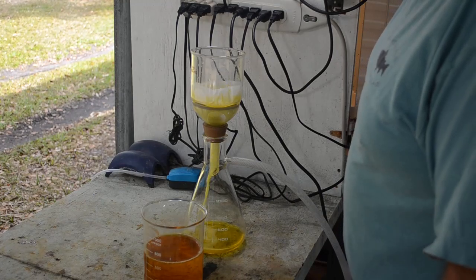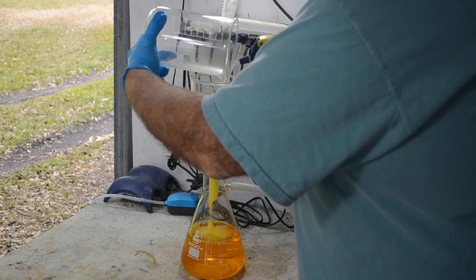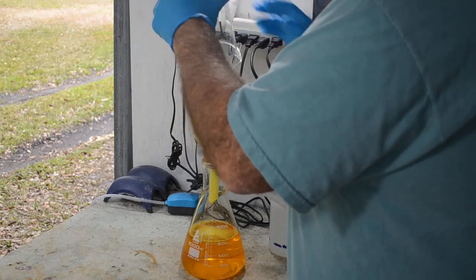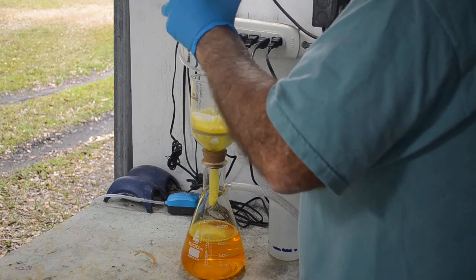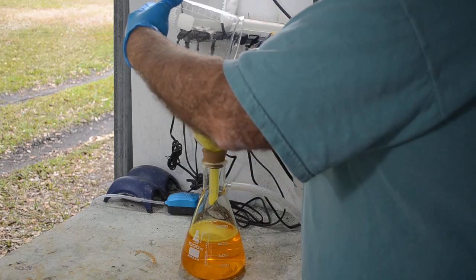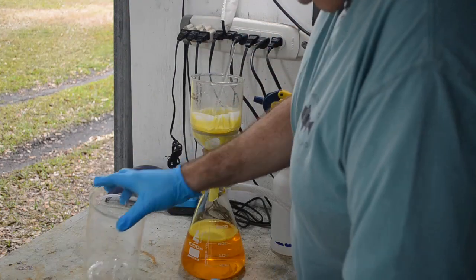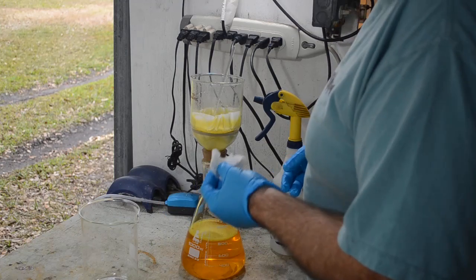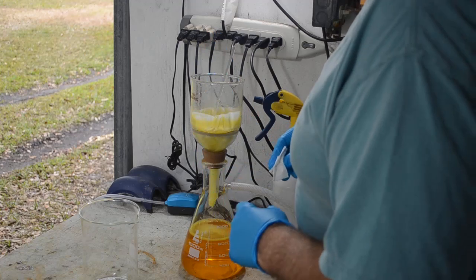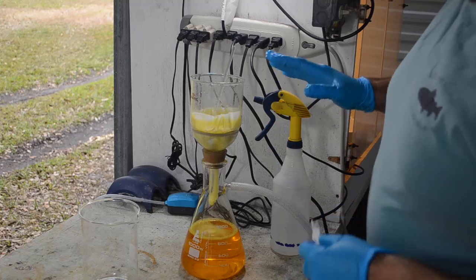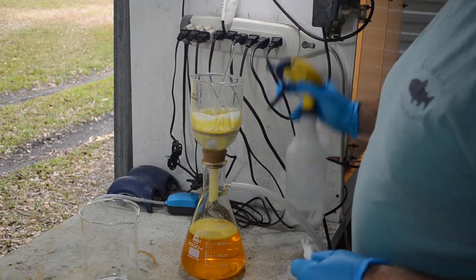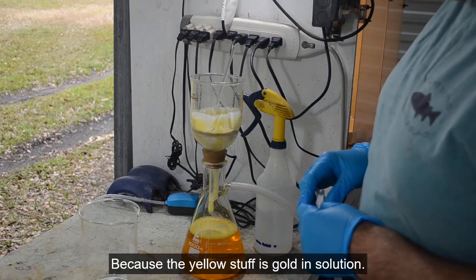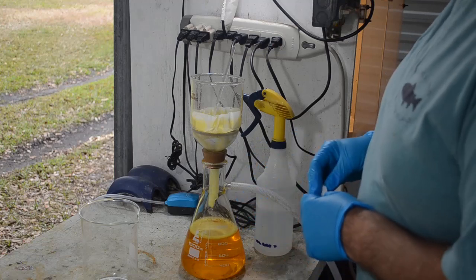Now we've got an even cleaner gold that way. Let me get this filtered and we'll filter all that crud out and we should have a nice clean filtrate ready for dropping our gold. A lot of gold went in this beaker, I'd like to get it back. I'm using my small filtration funnel, so this is going to take a little while. Got a little bit of a drop on the outside of the beaker here, you don't escape that easy, you get in there with your friends. It's a fairly concentrated solution of gold here, so every little drop counts.